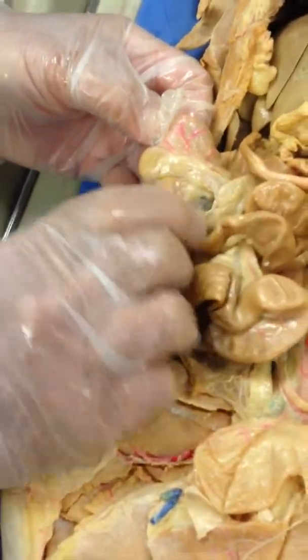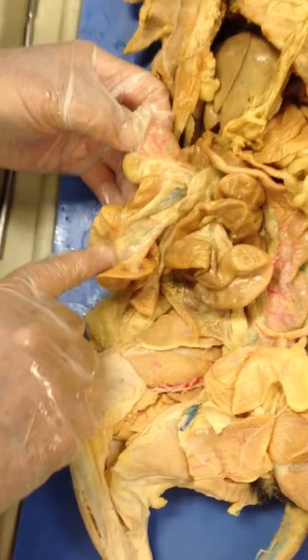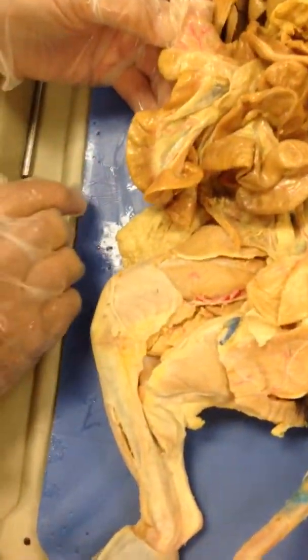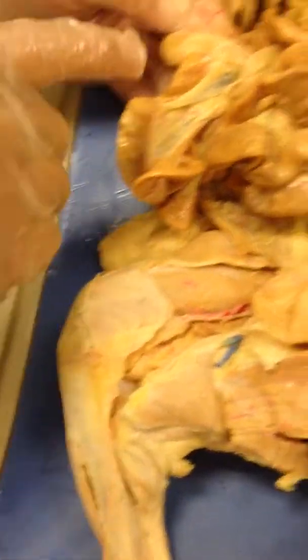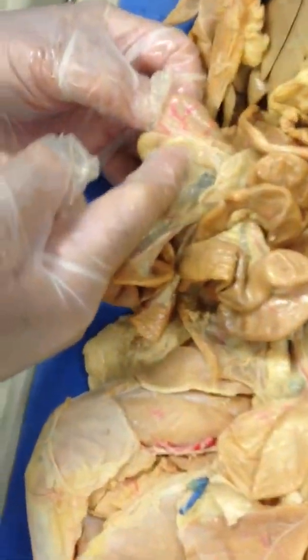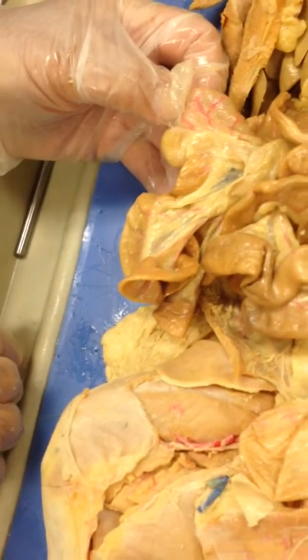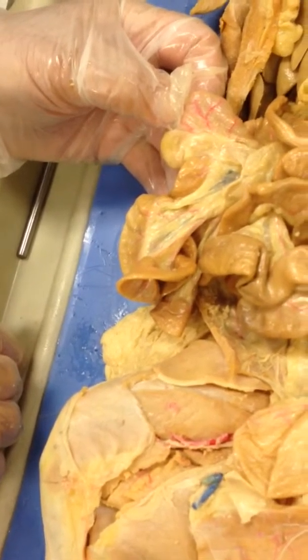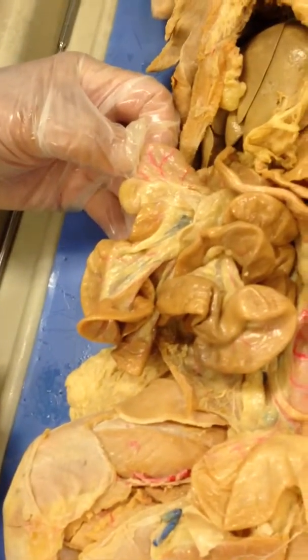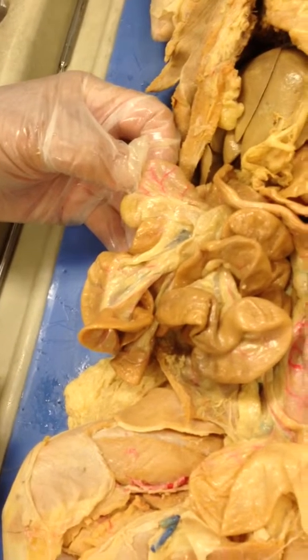And this distal section of the small intestine is the ileum. All the way going back up there, about two thirds of the way, is called ileum. So where the ileum joins the cecum is the ileocecal sphincter, which is where the small intestine becomes the large intestine.